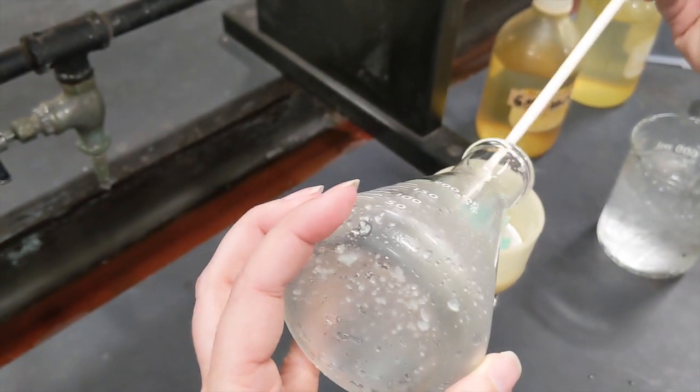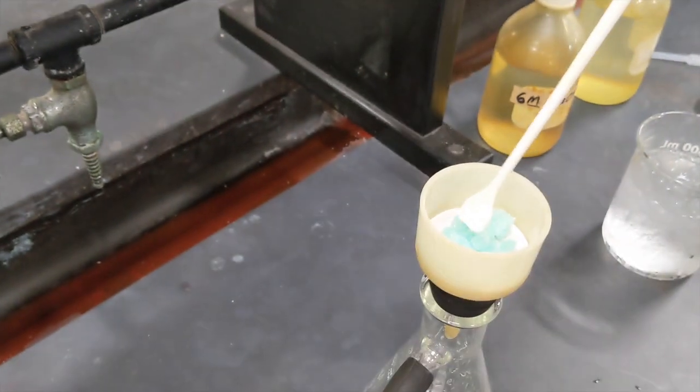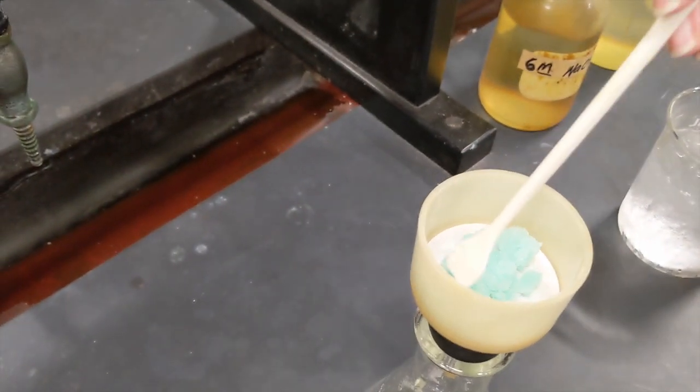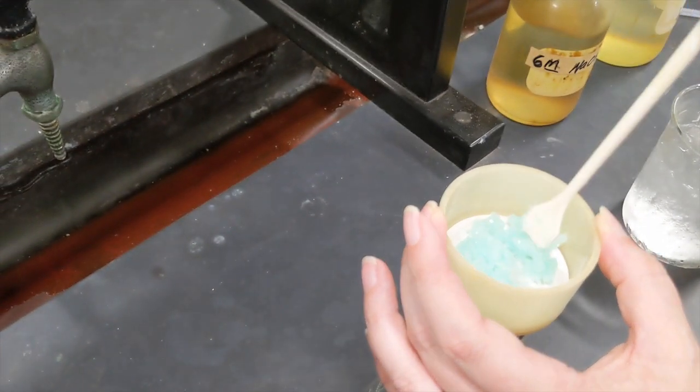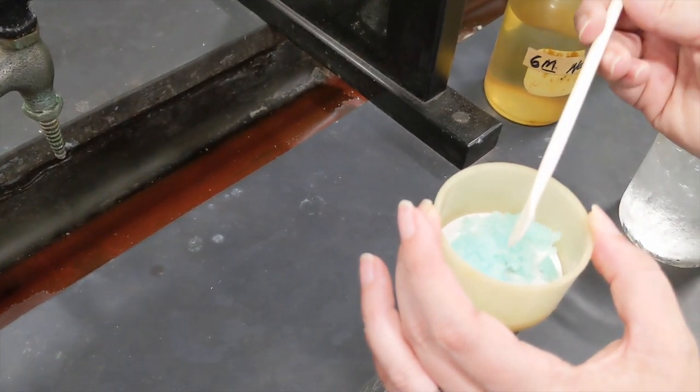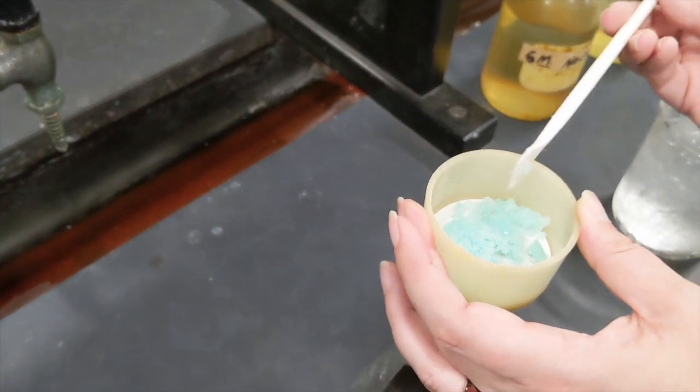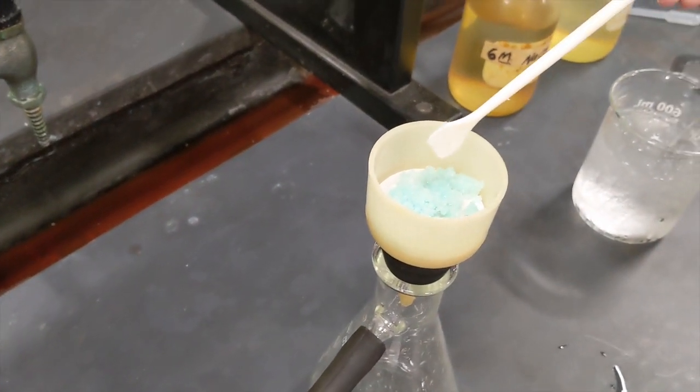All right, it reaches a point of diminishing returns where your effort isn't going to get a whole lot more solid out. So we're going to tap this to kind of help it dry, but to help rinse off more of the water, we're going to do sort of the same trick if you remember we did last week with the copper coils.